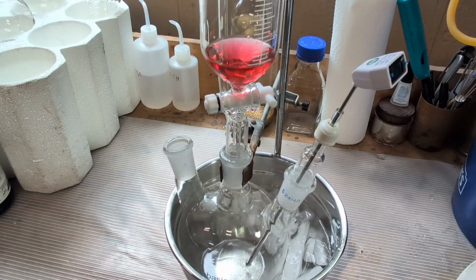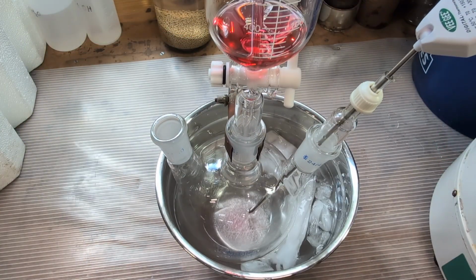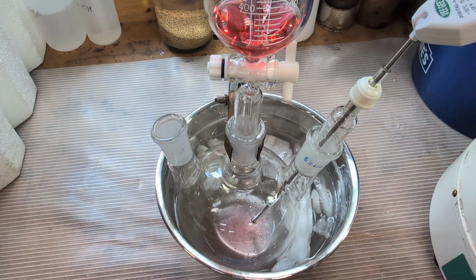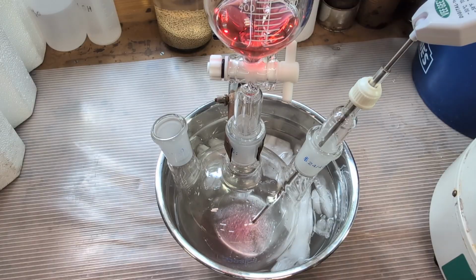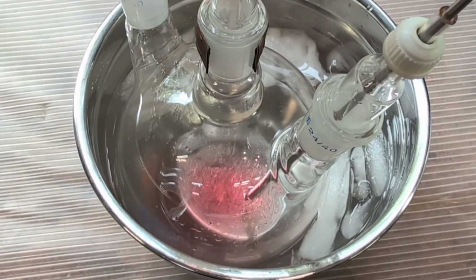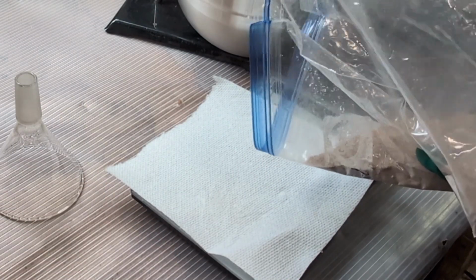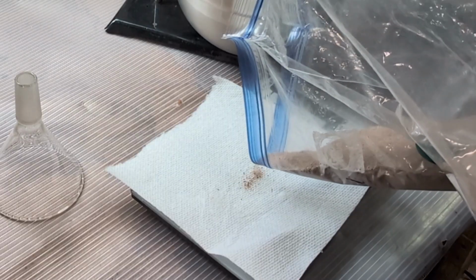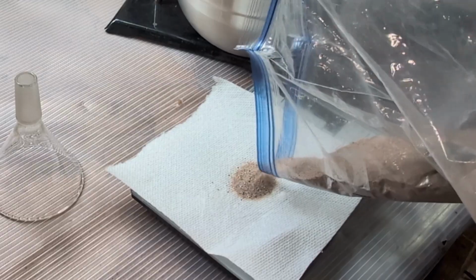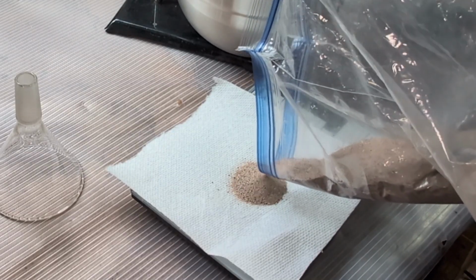After 10 minutes, the ethanol reaches approximately 5 degrees Celsius, and I begin adding the sulfuric acid dropwise, carefully controlling the addition rate to prevent the reaction temperature from rising too quickly. Once the solution is thoroughly mixed, I add 10 grams of sand previously boiled in sulfuric acid to remove impurities. The sand acts as a boiling aid, providing nucleation sites that help prevent bumping during distillation.